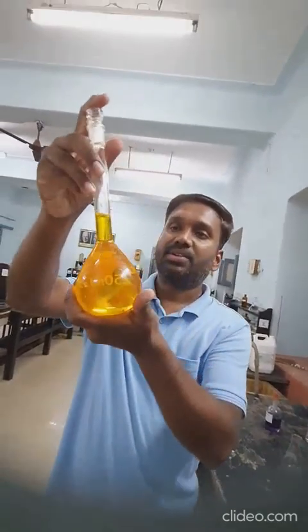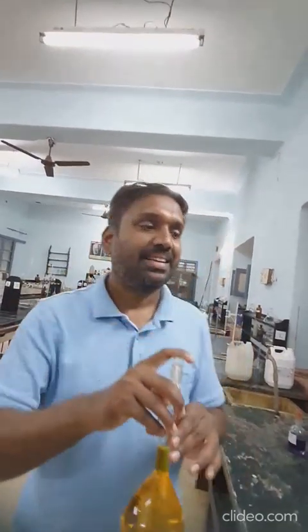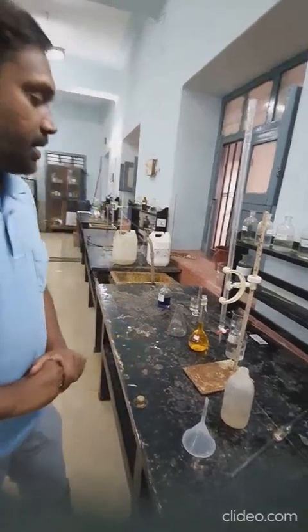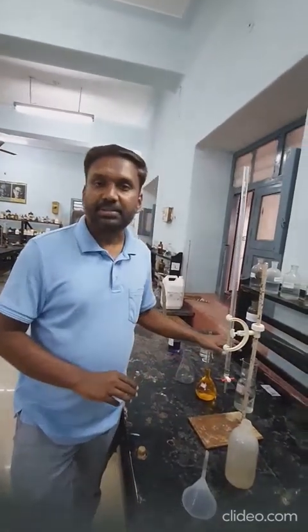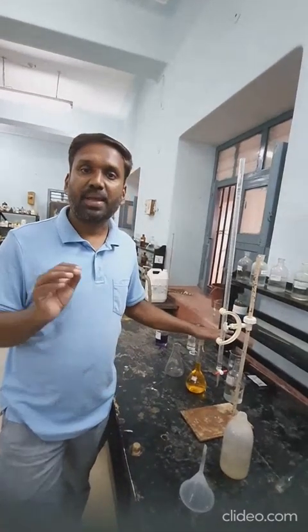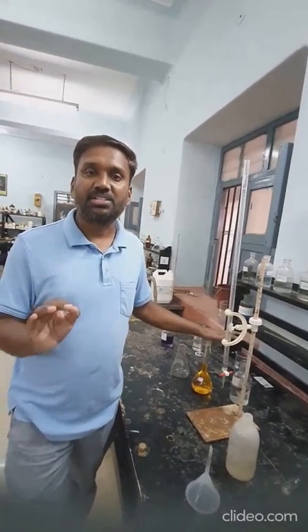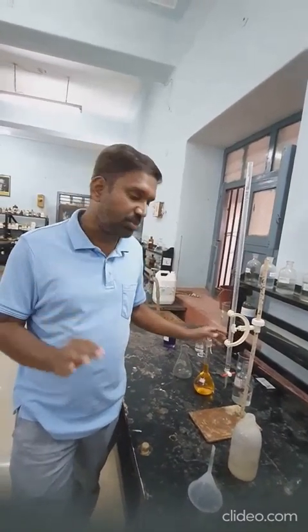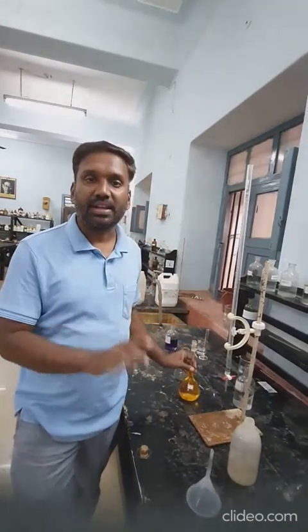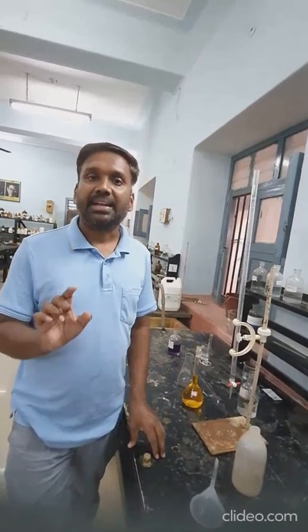You can see it is almost up to the mark. This is the first step where you make ready your standard potassium dichromate solution. Calculate the normality of this using the weight you have taken. This constitutes the first step of the titration experiment.